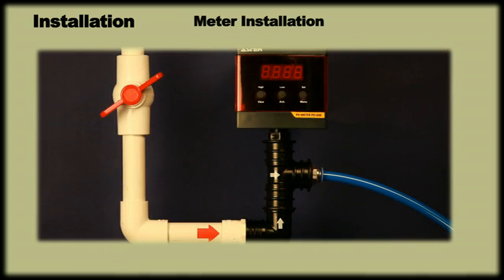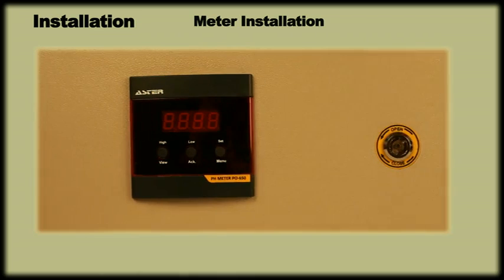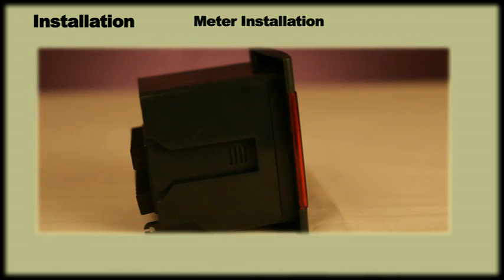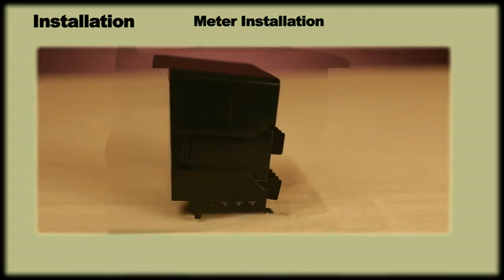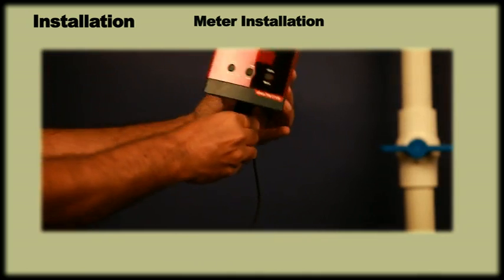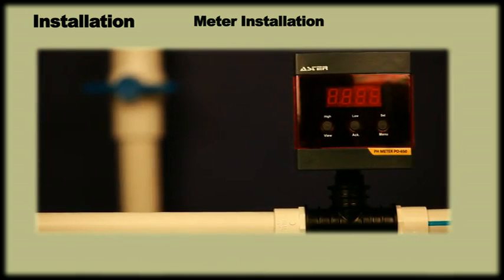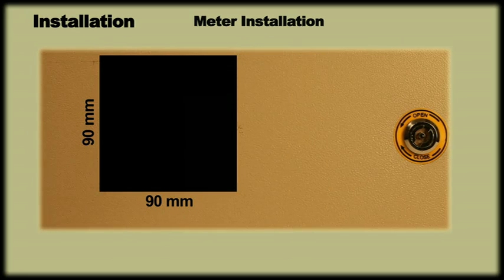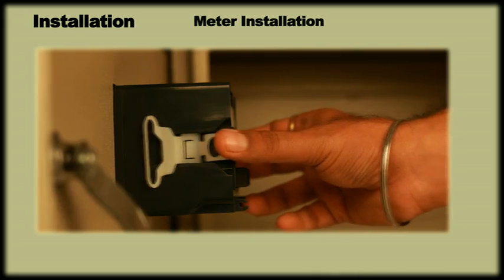Meter Installation: The meter is designed to suit both field and panel mount applications. For field mounting, the meter comes with a sensor mount option. The meter has slide grooves on 3 sides of the enclosure that can be used to slide the plate of the sensor. This ensures that irrespective of the orientation of the sensor, whether it is on horizontal or vertical line, the meter display always remains horizontal. For viewing convenience, it is always advisable to mount the meter at an eye level. For panel mounting, make a 90mm by 90mm cutout on your panel plate. Slide the meter through the cutout and fit it with side clips to lock.